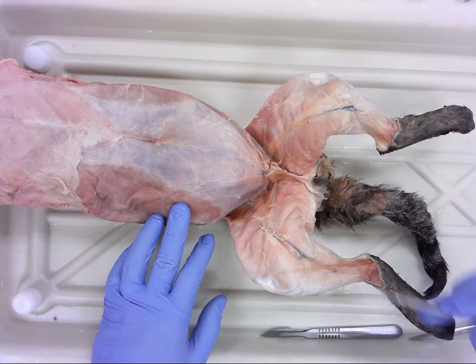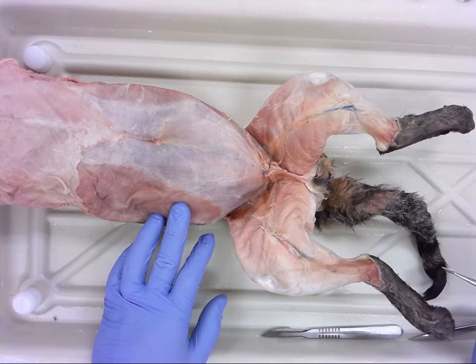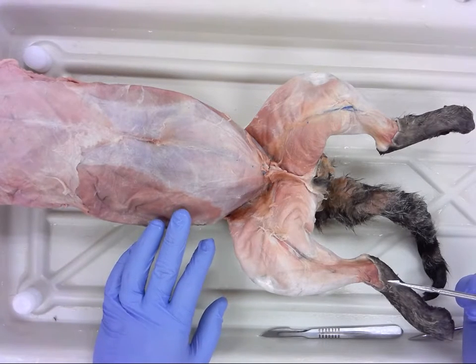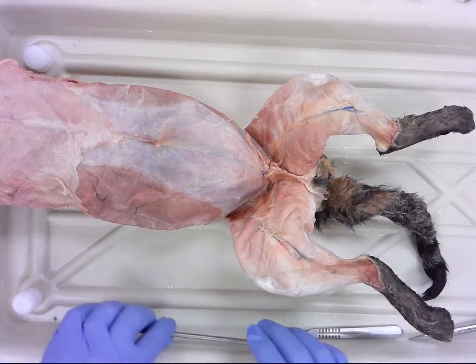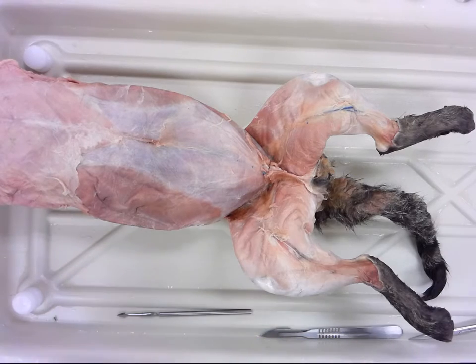We will also get into the lower limb, where we have what is commonly known, in layman's terms, as the calf, but we will use more technical terms of gastrocnemius and soleus as we get into that. Also identifying the Achilles tendon that those both attach into.